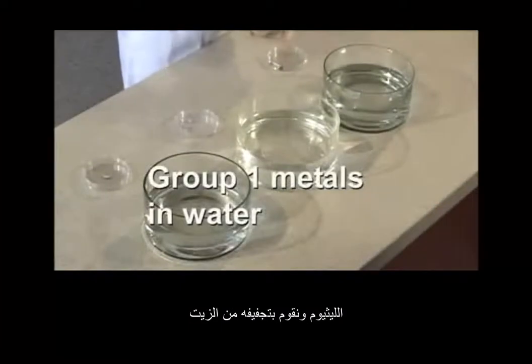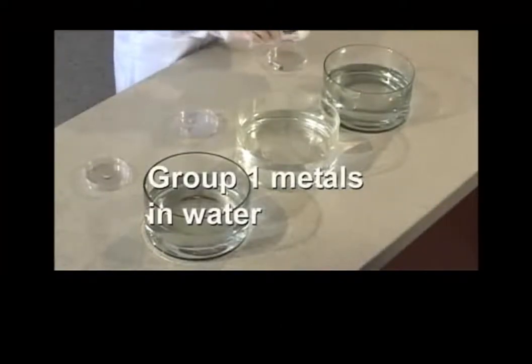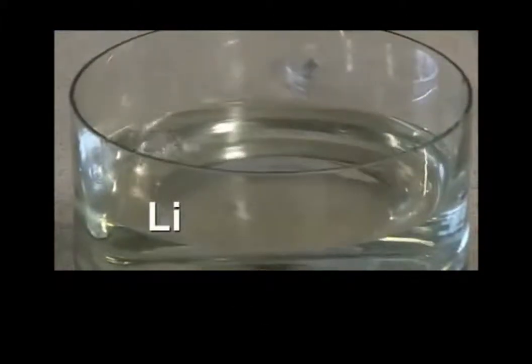Lithium, dry it off with a paper towel. Put it in the water.